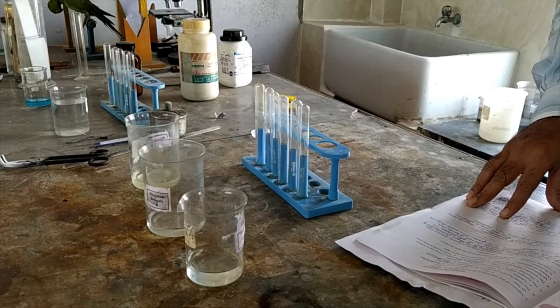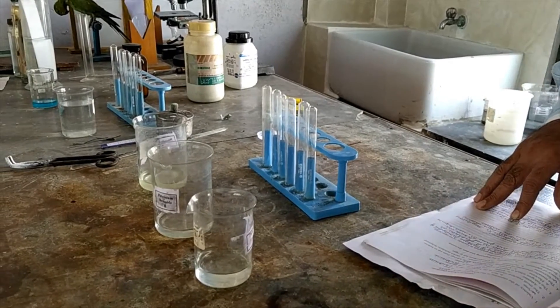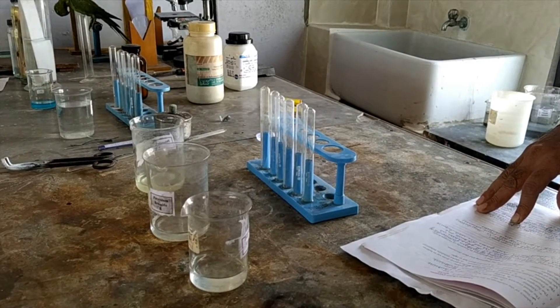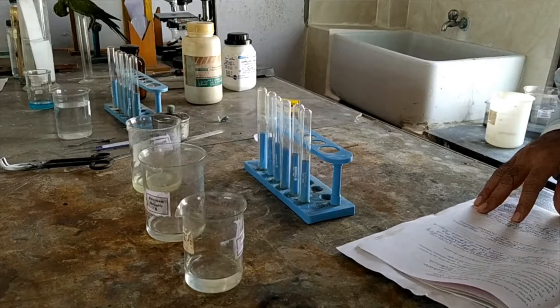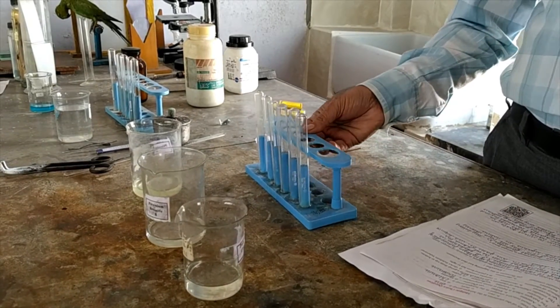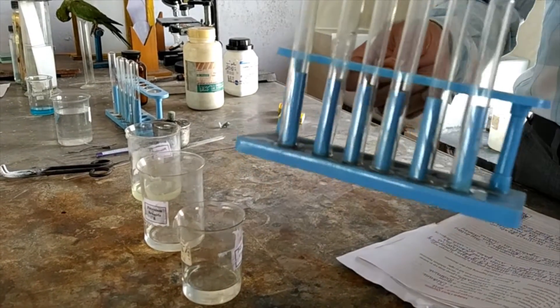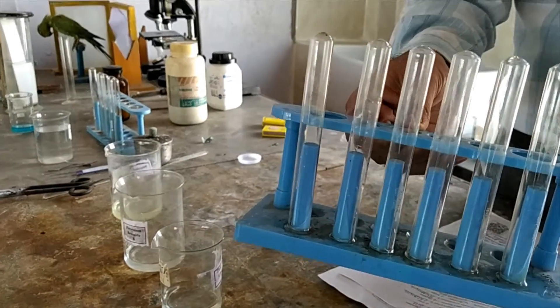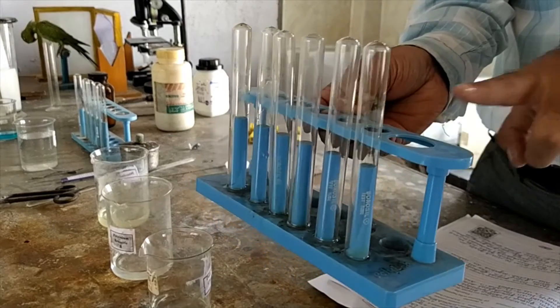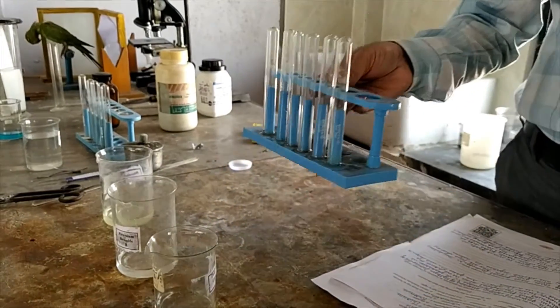For this practical you require the following apparatus: test tubes and a test tube stand. See here — these are the test tubes and the test tube stand.